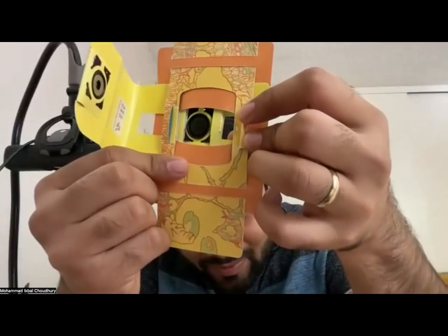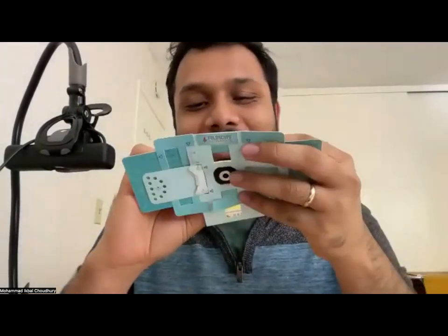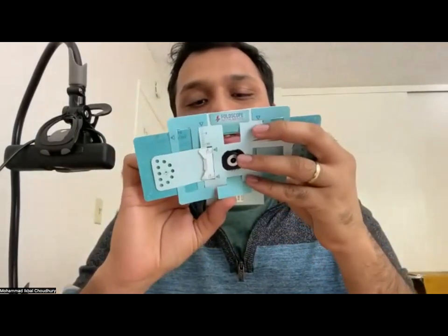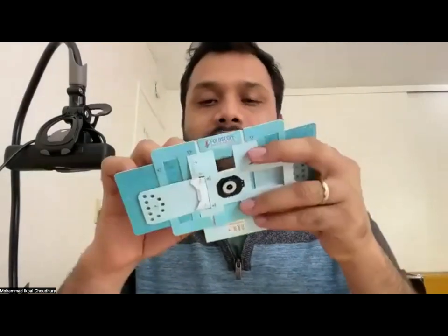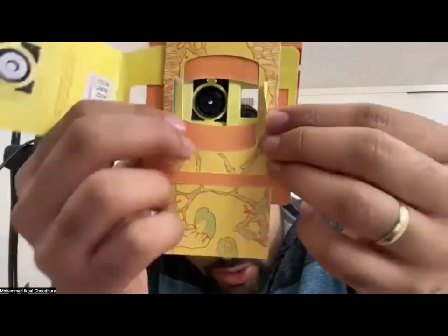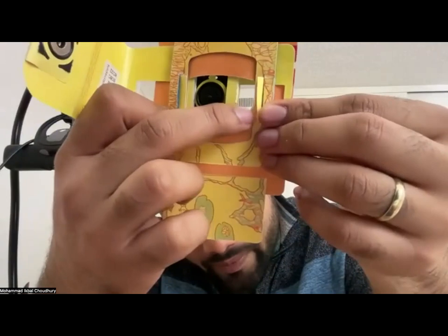No, still can't see it. Interesting. There should be one. So what happens sometimes, there are two flaps there. So if you pick up the wrong flap, then you won't see that there's this flap beneath it. Also, when we say arrow, it's like a small white triangle. It's a small white triangle that is drawn here, indicating that that's where your sample needs to go.